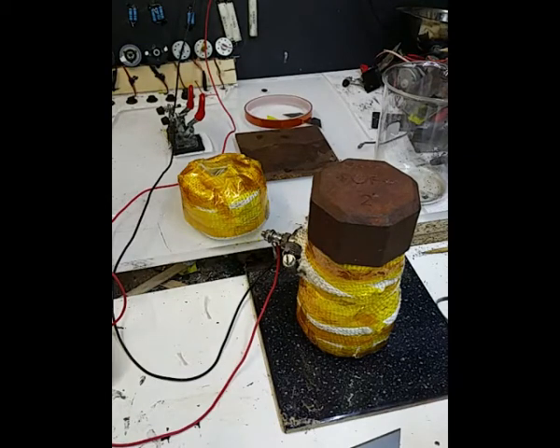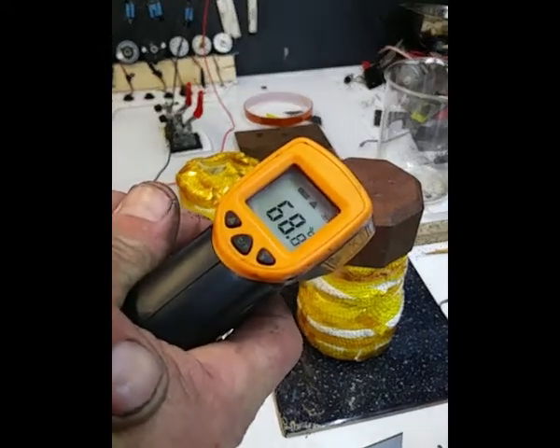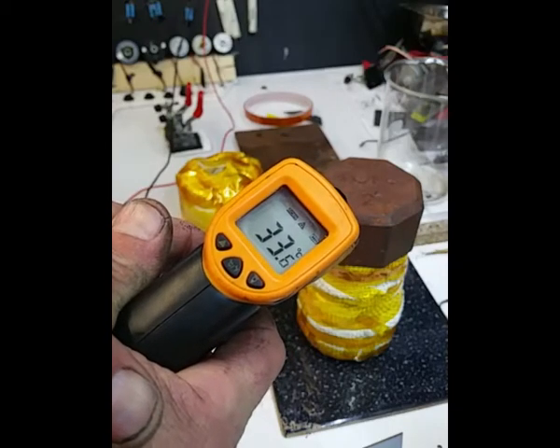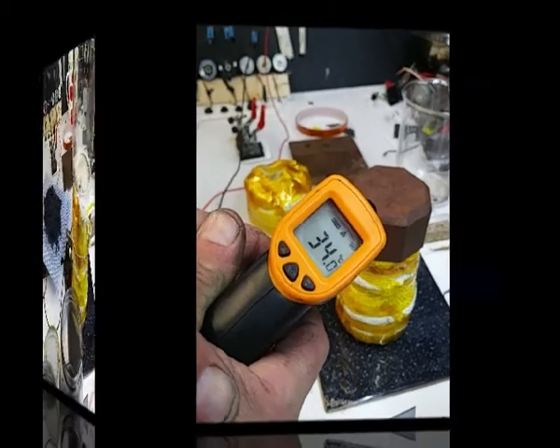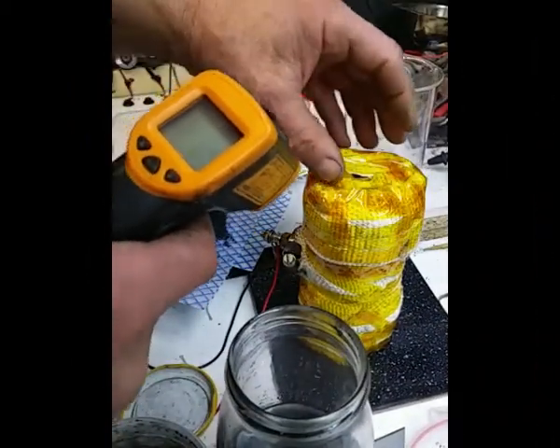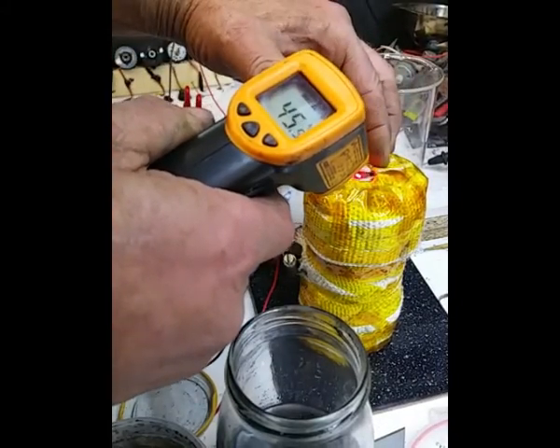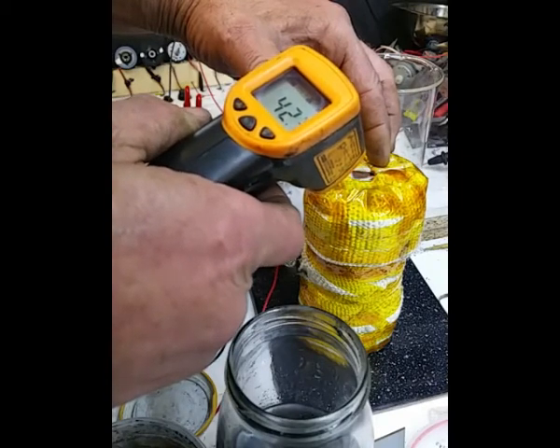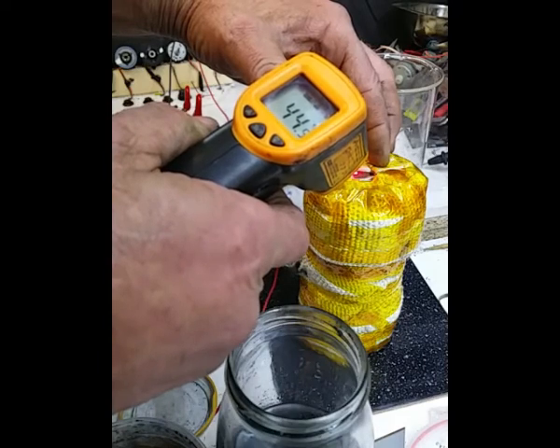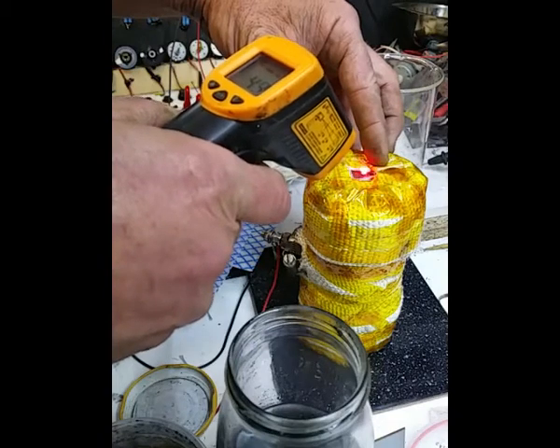I did notice that on this thing you couldn't see a 7 because I've got a blob of something on there, but just check the temperature and yeah, temperature's coming up. Right, well it's been about, I don't know, 5-6 minutes, something like that. I just wanted to check this and see what we've got. Temperature is going up, no two ways about it.